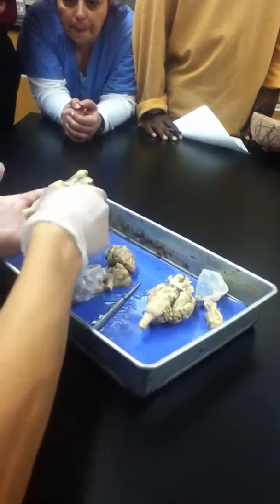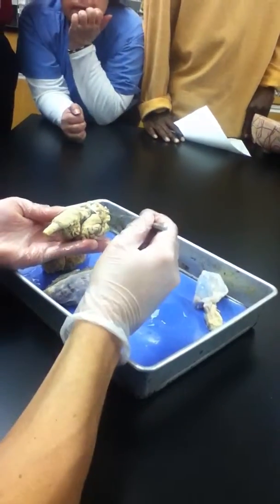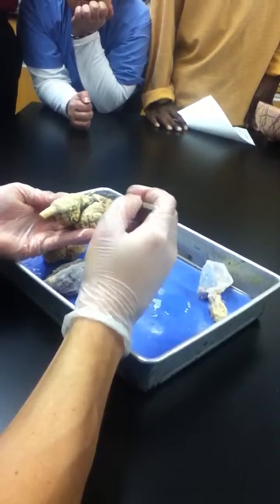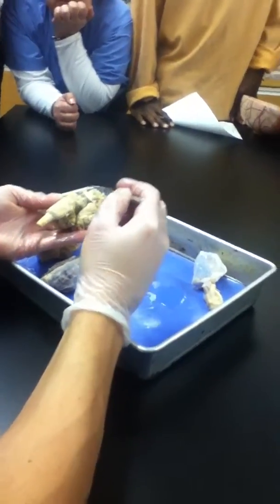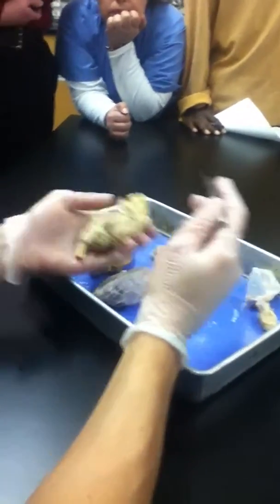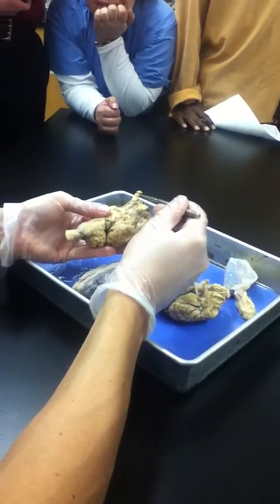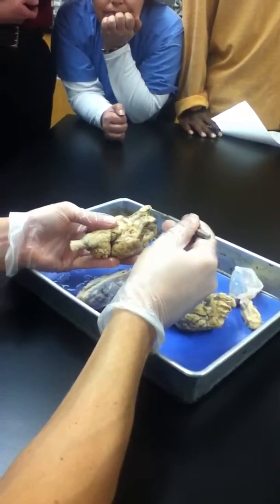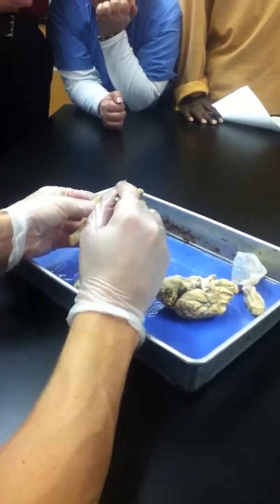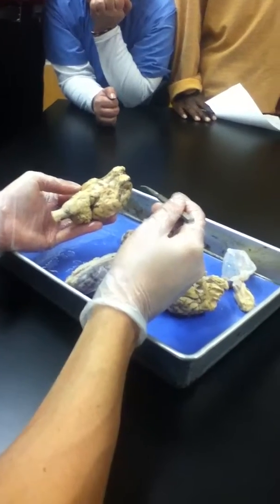It was cut, unfortunately, really short on this one, so I'm going to jump to this one. It's still wrapped in dura mater, but what do you think this is? The optic chiasma, the two optic nerves forming the X. Then something happened up here, so we'll jump back to this one. This one got a little messed up, but what do you think this is? Olfactory bulb leading to this, the olfactory tract. Good. So those are the only cranial nerves I will ask you on the sheep brain.